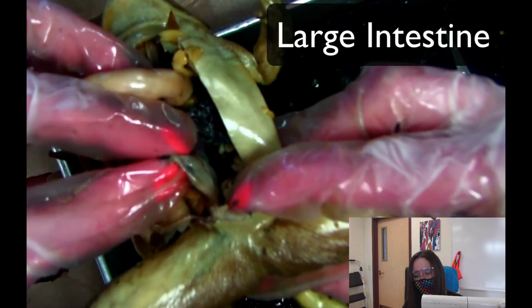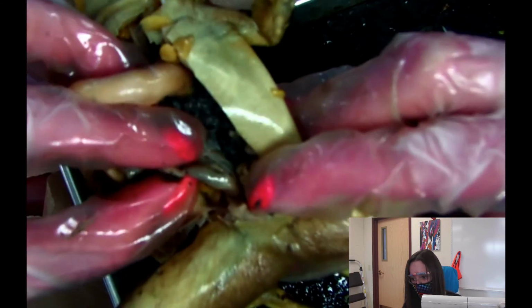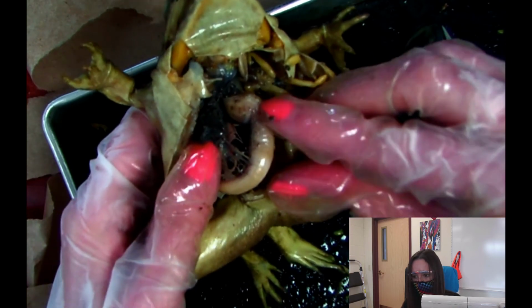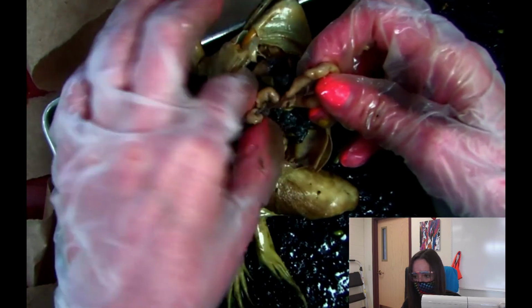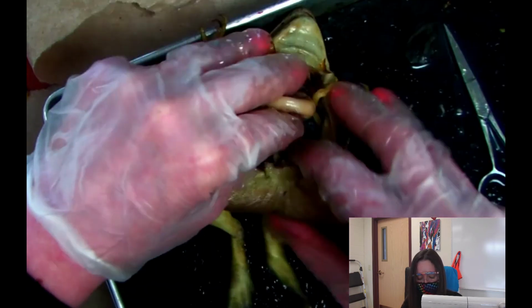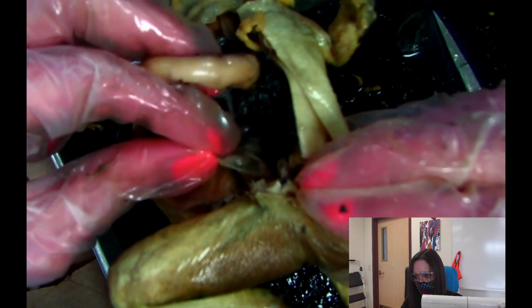It's really short, but it's thicker. So it is the large intestine. So it goes, and we'll do this probably in order on the quiz, just so that you don't get messed up. Here's the stomach. And then you have this longer structure, which is the small intestine. And then you have this bottom structure right here. Oh, I brought that up really close. That's the large intestine. So it's just really short.